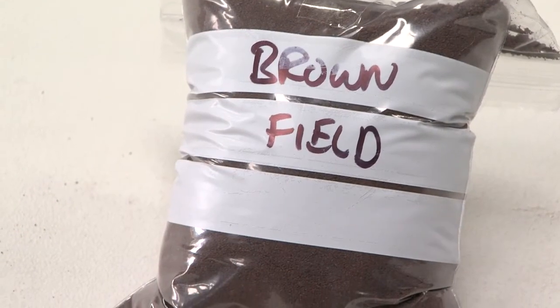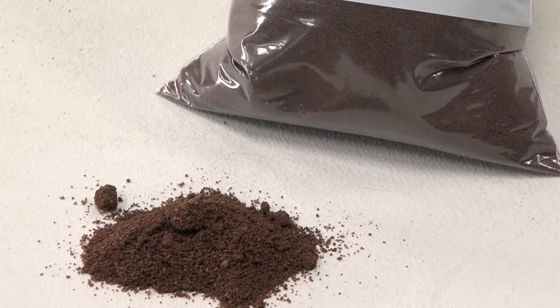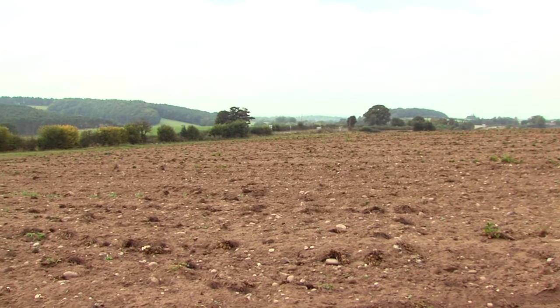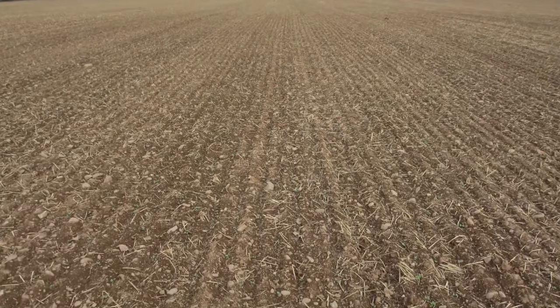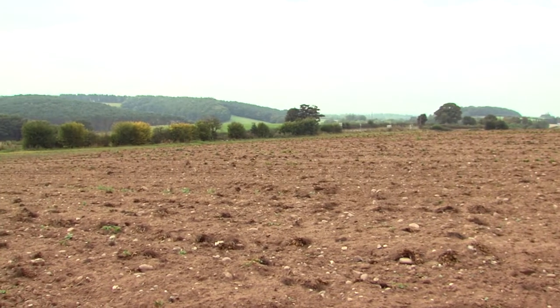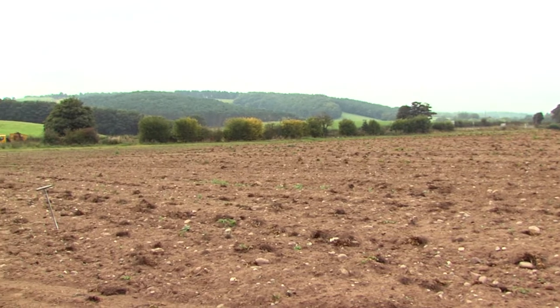It is important to collect a sample that is fully representative of the field. The laboratory only uses just a few grams of the sample you send. You may choose zones within the field — is the crop still to be planted? Use the whole field. Or does it exist in a defined root zone? Sample just the beds. It is very important to cover the complete cropping area you are surveying to get the best representation.